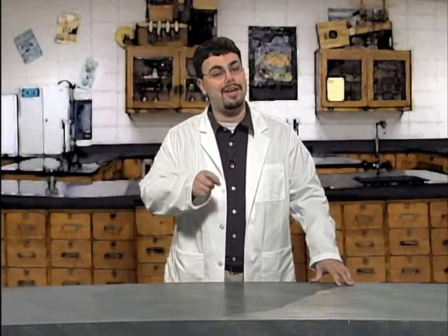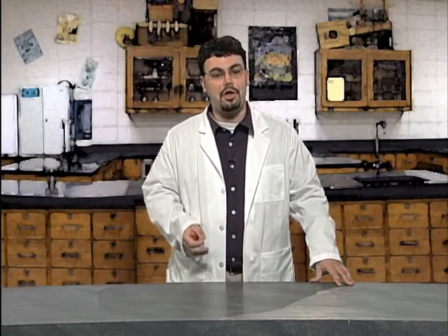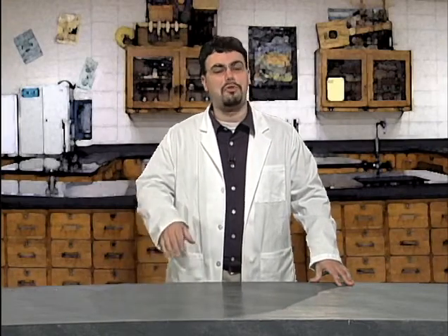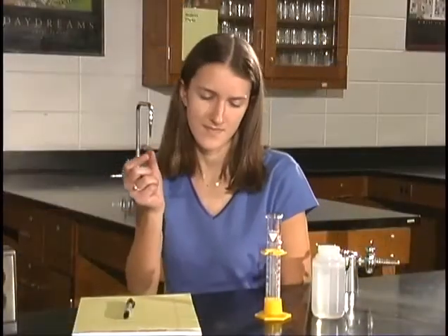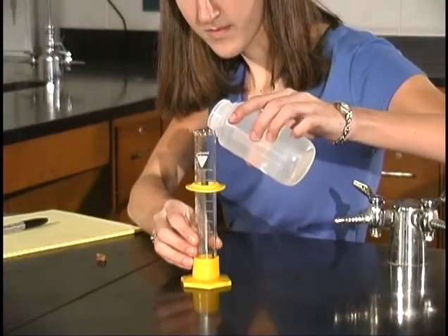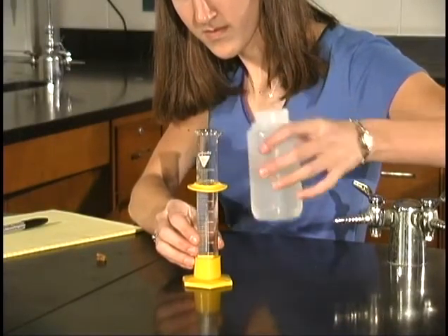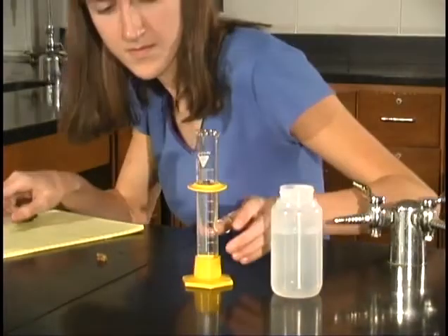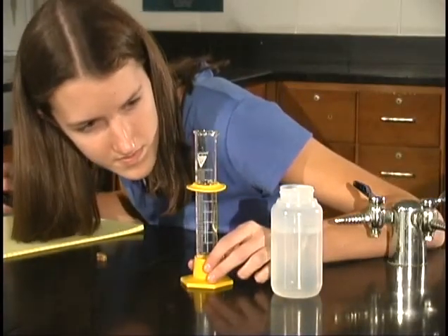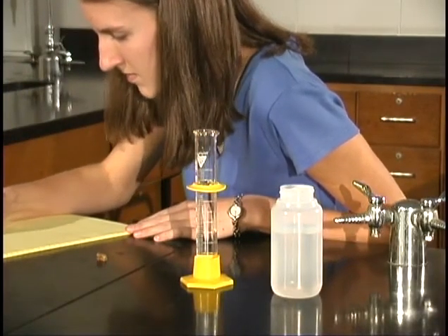Did you come up with some good ideas? Did anyone suggest trying to find the volume by a method called water displacement? You probably learned about this in middle school, but just in case you have forgotten, let's go through the process. The first step is to pour some liquid, usually water, thus the name, into a graduated cylinder and record its volume. Students always ask how much water they should put in. It doesn't matter. Let's finish going through the process, and then we will discuss why the amount of water doesn't matter.